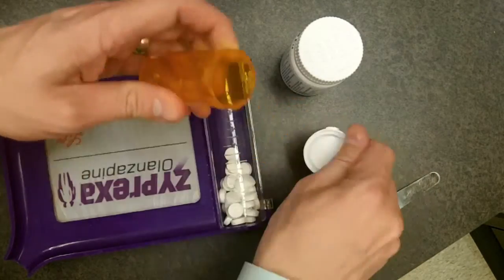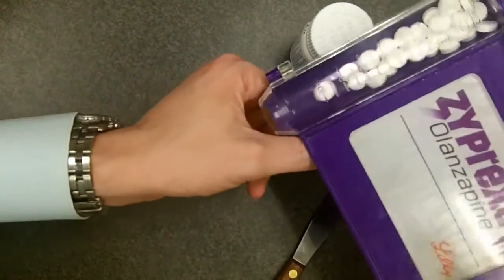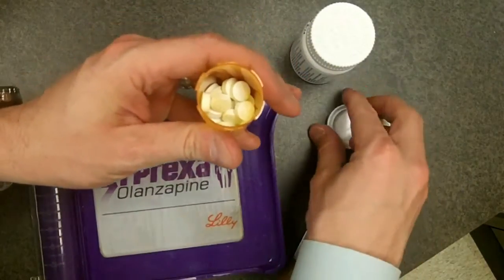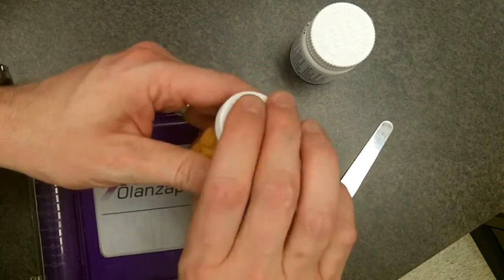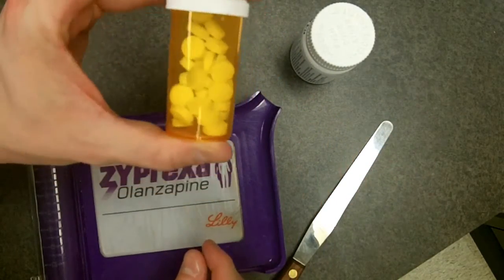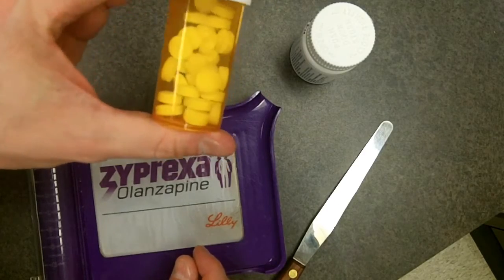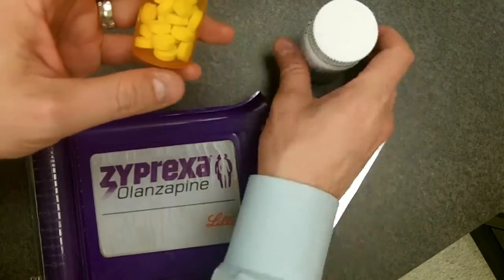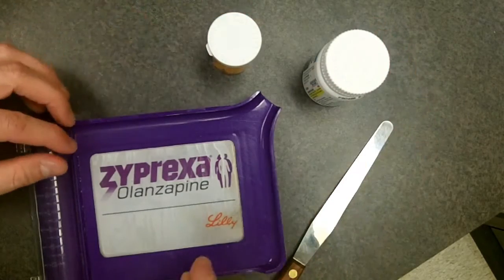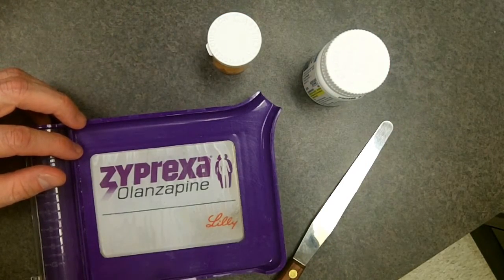This is a 13 DRAM prescription bottle, so I want the smallest prescription bottle possible and this will be fine. I'll just pour it into the bottle. Notice my hands never touched a tablet the entire time — we are able to stay sanitary. I can close it up and voila! We have a 30 count bottle of aspirin poured from the stock bottle.